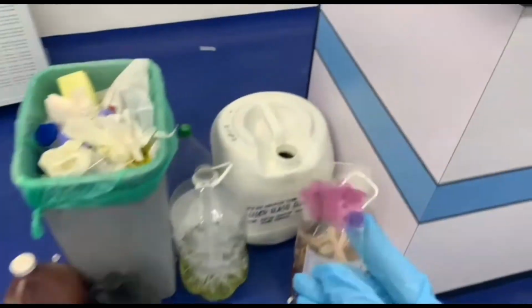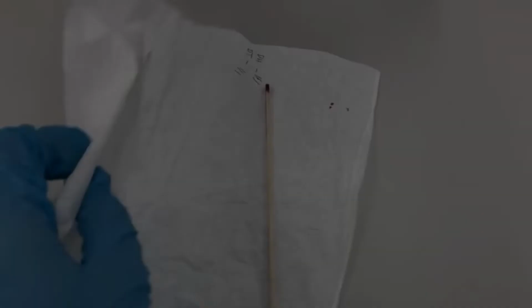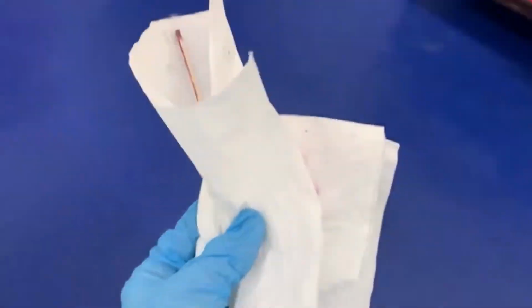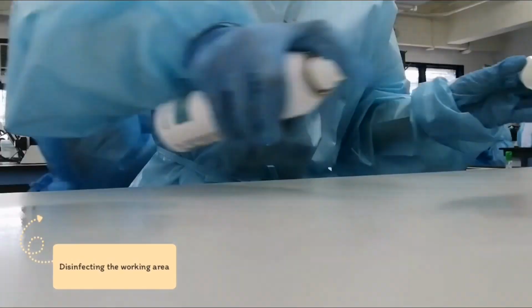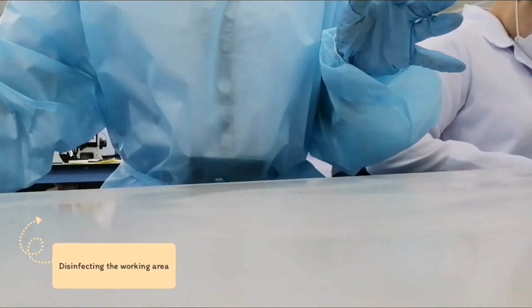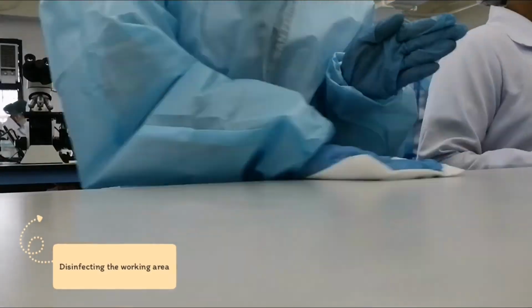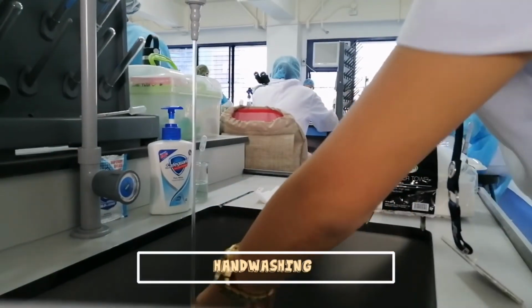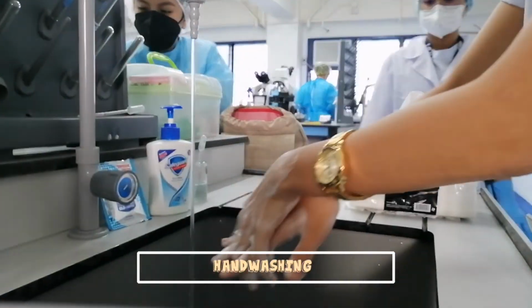Do not forget to dispose all the contaminated materials to their proper waste containers. After the disposal, you must disinfect the working area. Lastly, you must perform hand washing after all the procedures and after doffing of PPE.